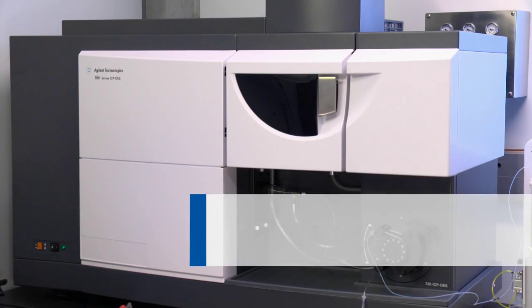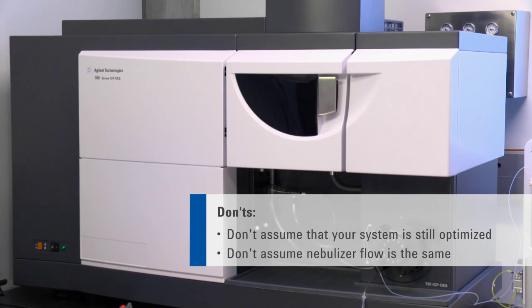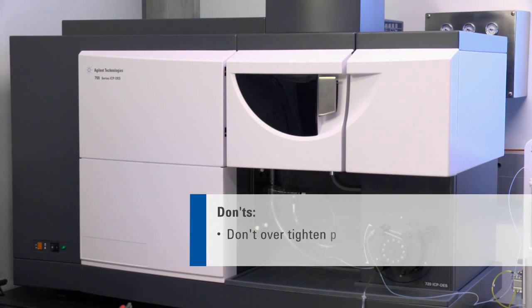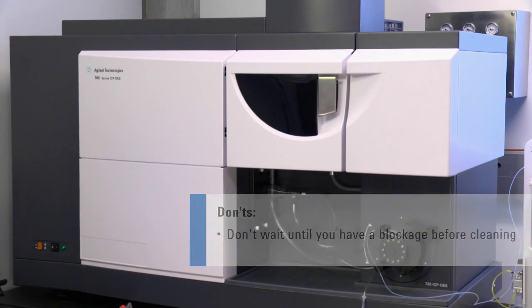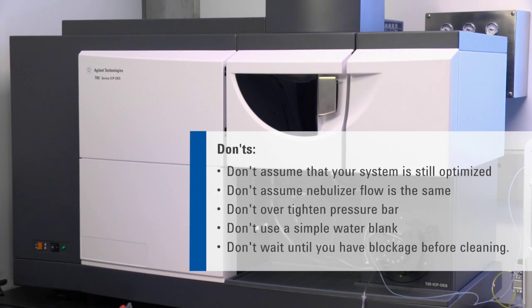There's a similar list of don'ts. Don't assume your system is still optimized or that the nebulizer flow rate is the same. Don't over tighten the pressure bar or use a simple water blank. And don't wait until you have a blockage before cleaning. These simple steps can prevent problems from mounting up.